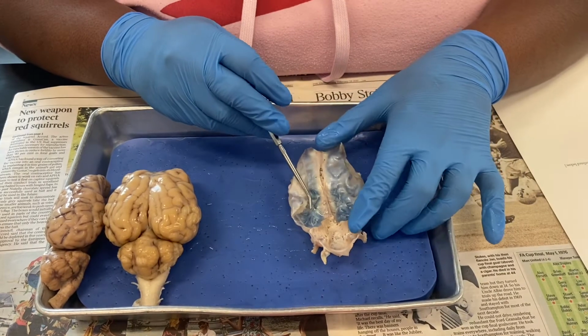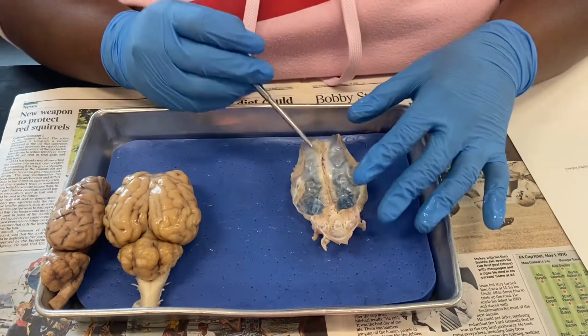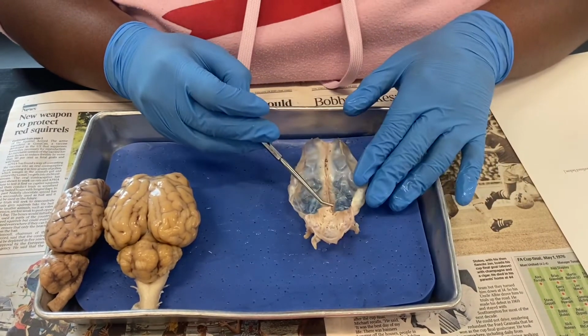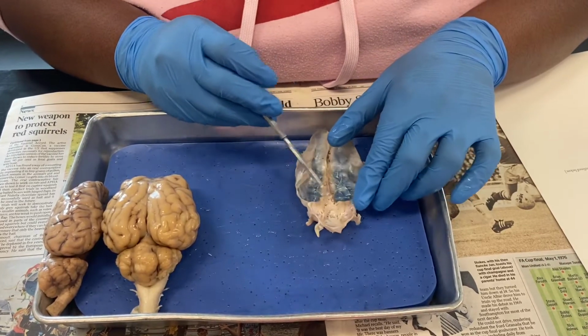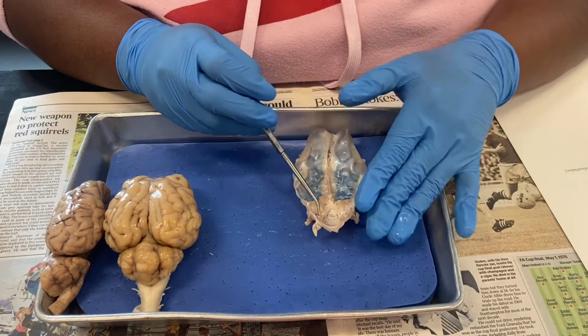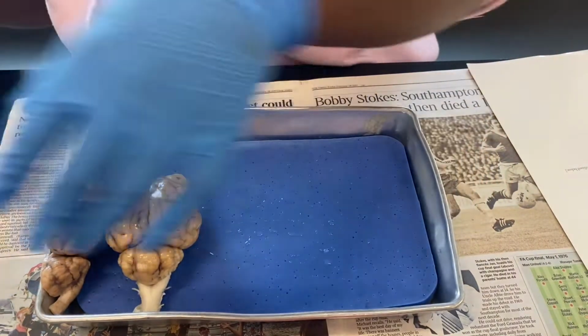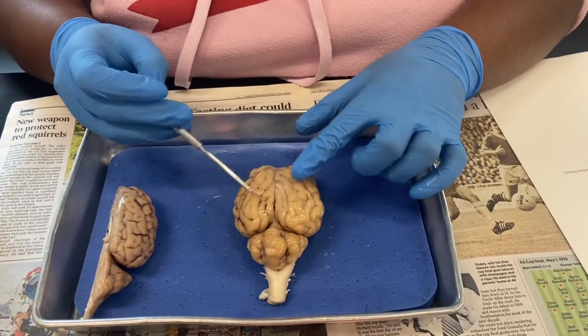This is going to be the start of our meninges right here, which is basically just the covering of the brain. This is the dura mater, which is the sac-like thing. The middle lining is going to be the falx cerebri right here, and then you come down and have the tentorium cerebelli, which is going to be covering your cerebellum. And then once we're done with this, you come over to the actual brain, and the glossy covering that's covering it is going to be your pia mater.